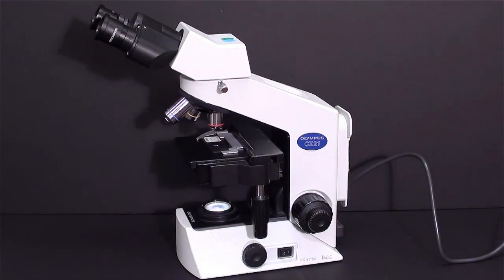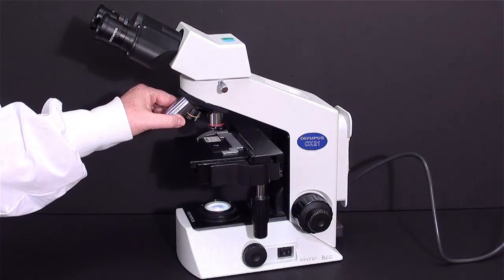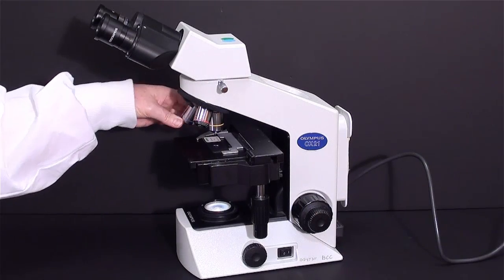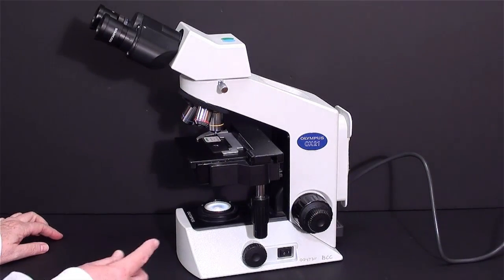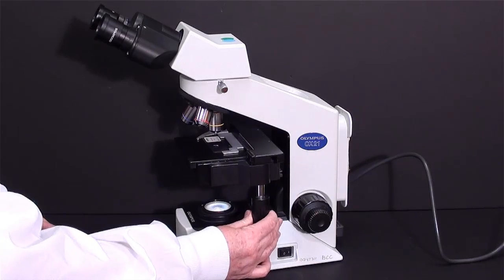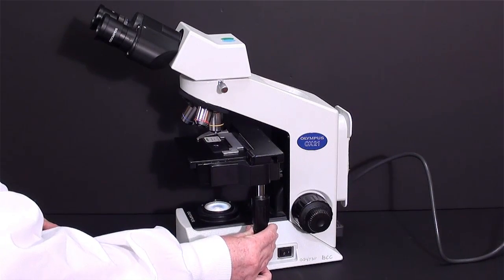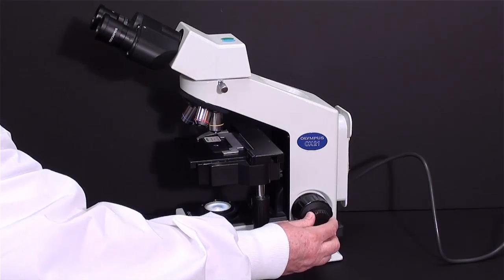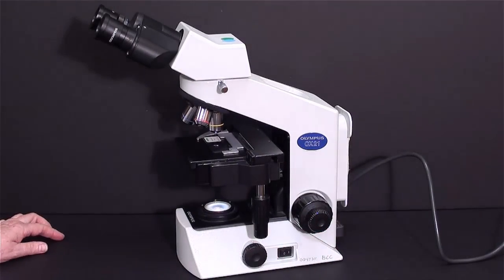Once you've centered the object within the field of view, you can change the lens to the next higher magnification. Now you must repeat the process, centering the object and using only the fine focus this time to get it into very clear view.